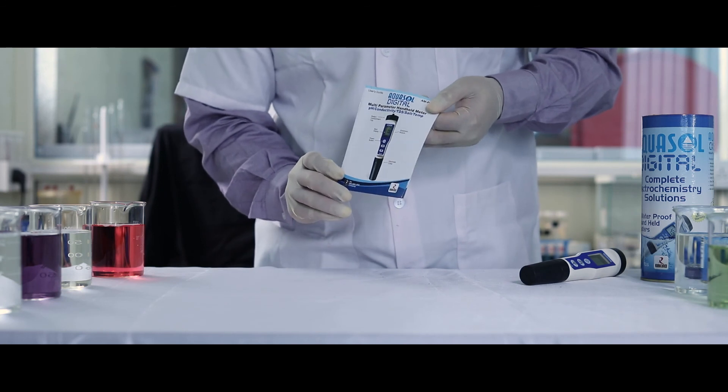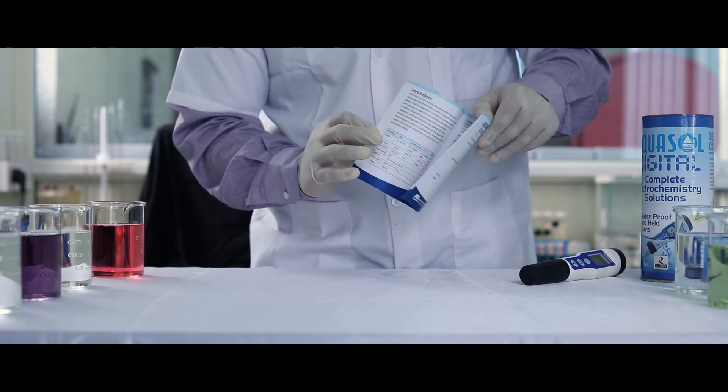For better understanding of this product, please refer to the instruction leaflet provided.